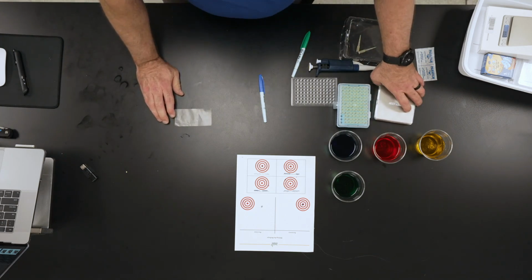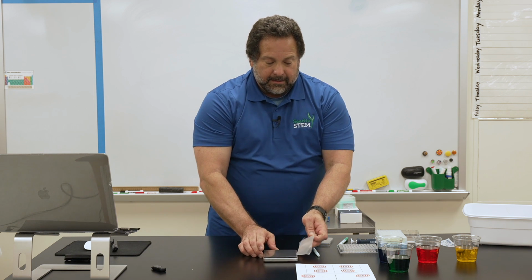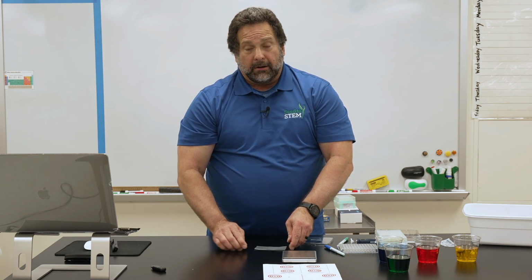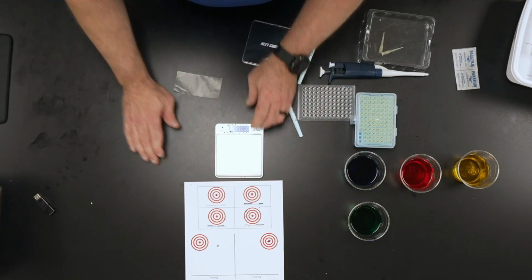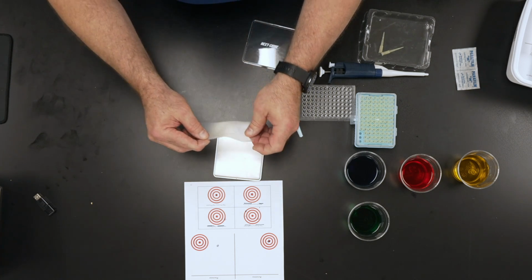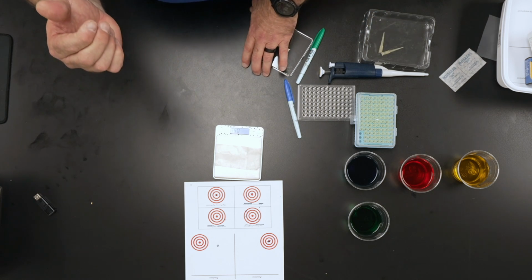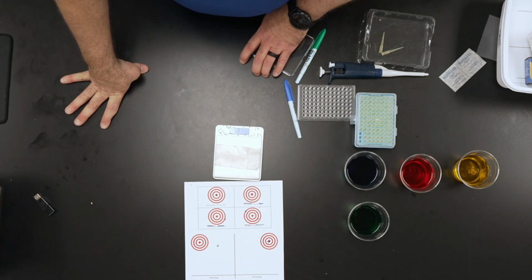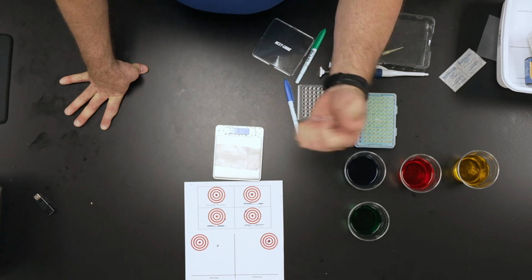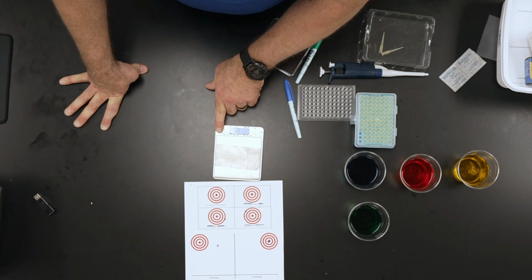So the activity that you're going to do is very simple. You're going to take your digital scale, okay, and to determine how accurate and precise you are, you turn on this digital scale, and it should register 0. You're going to put on your piece of wax paper. I don't have to find the mass of the wax paper, because really what I want to use is the density of water. These are all just colored water. The density is 1, which means if I've got 1 ml of the solution, it should weigh 1 gram, okay? So that premise of the density of water is what we're going to use.